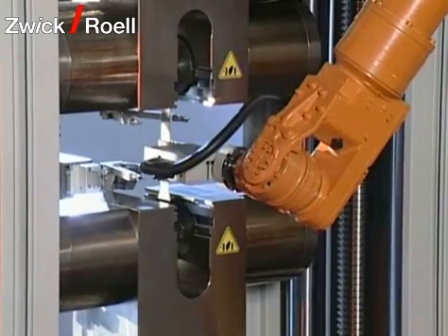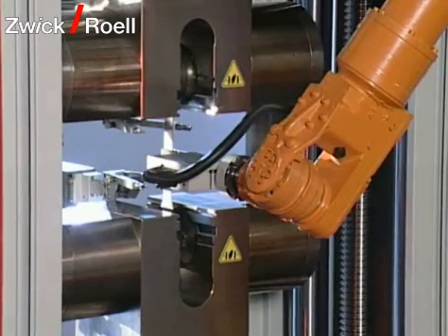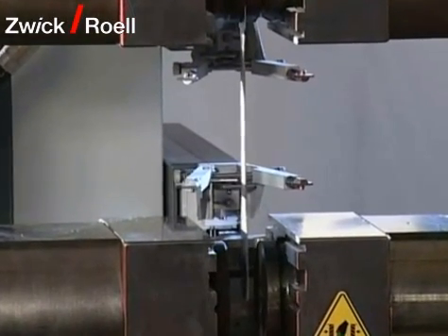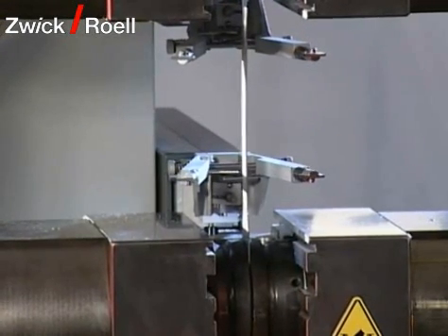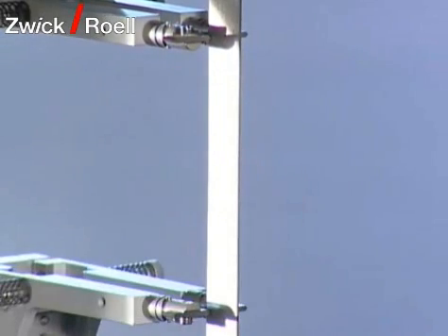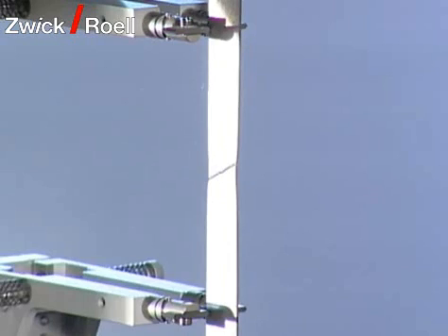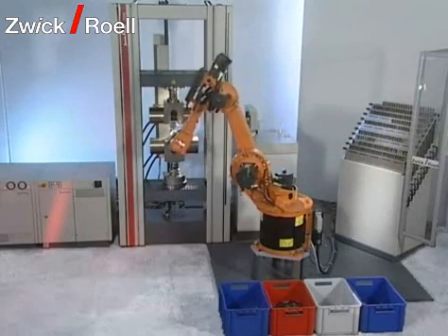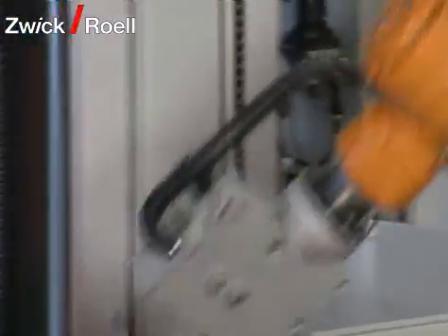First of all, the specimen grips close. Then the feelers are attached and the tensile test starts automatically. After the test, the two specimen remains are put into the specimen removal containers.